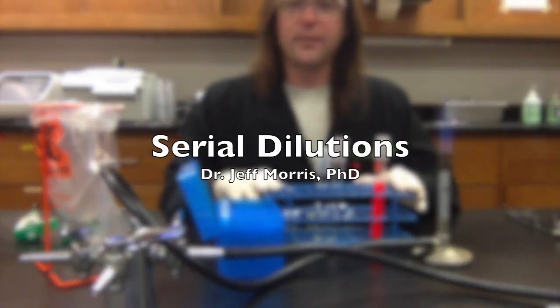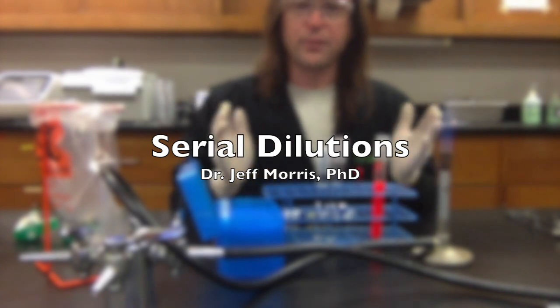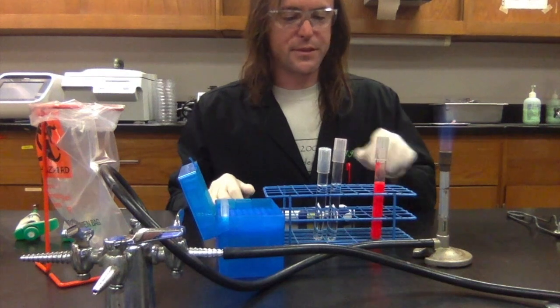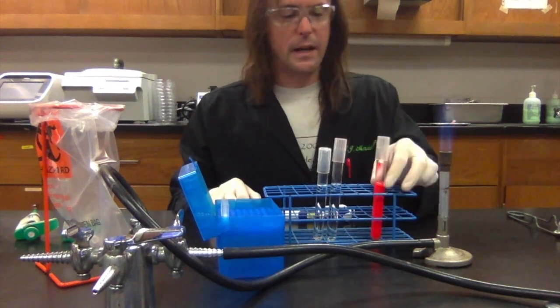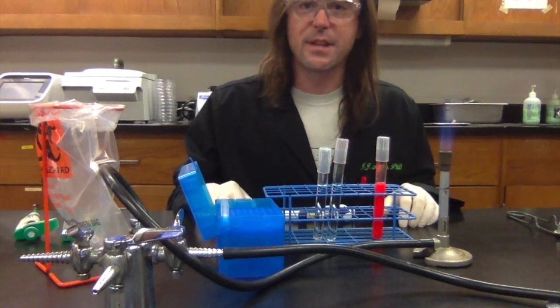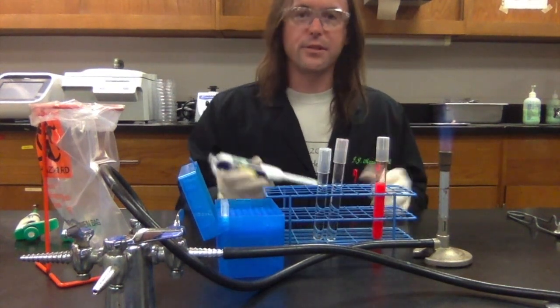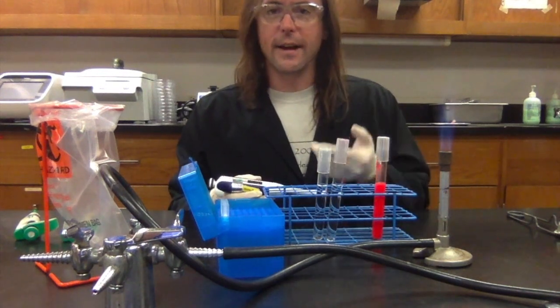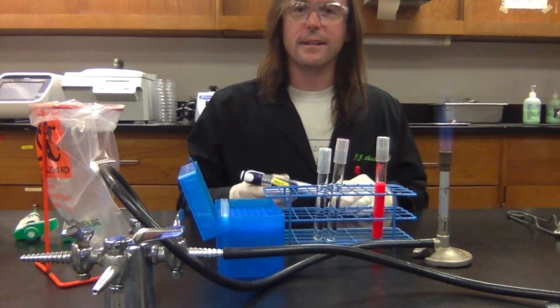All right, so what we're going to do right now is I'm going to demonstrate how to dilute a sample using a micropipetter. So you can see we have 3 test tubes here. One of them contains this bright red liquid. The other 2 just contain sterile water. Okay, so what I'm going to do is I'm going to move 500 microliters from this bright red tube into this one. It's going to become, obviously, less red.